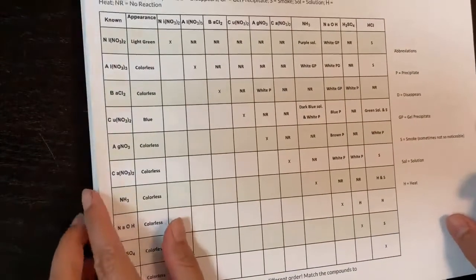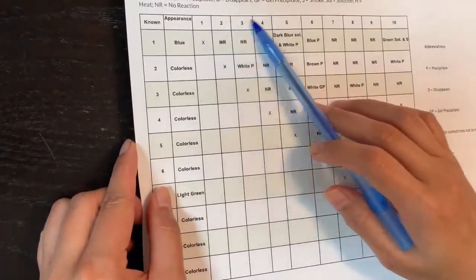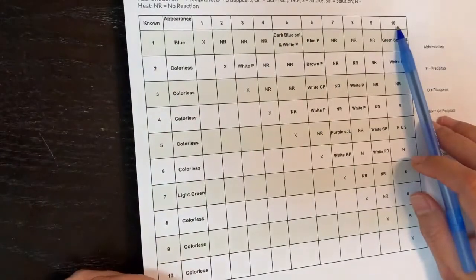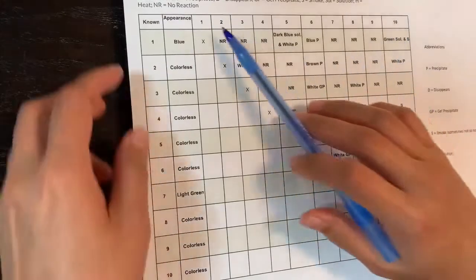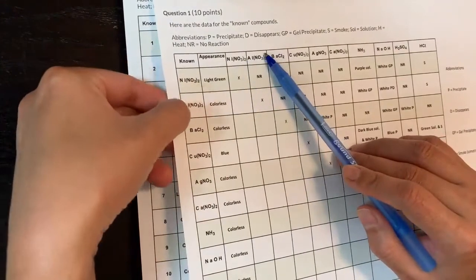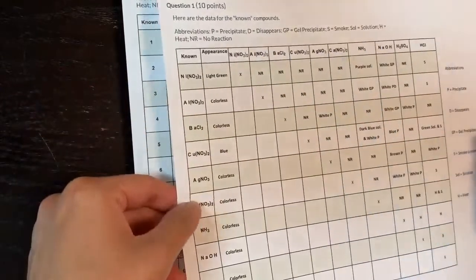Now let's look at the unknown table. The chemicals are still the same 10, but they're all jumbled up. Your job is to figure out which number is which chemical. Keep in mind that whatever chemical is assigned a number appears in the same position on both axes of the grid — so both the row and column for that number are the same chemical.